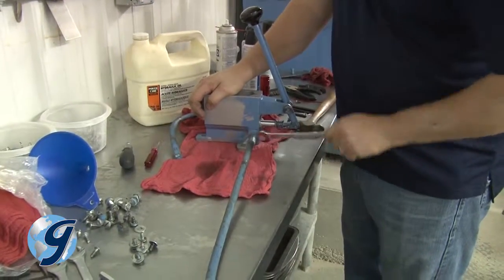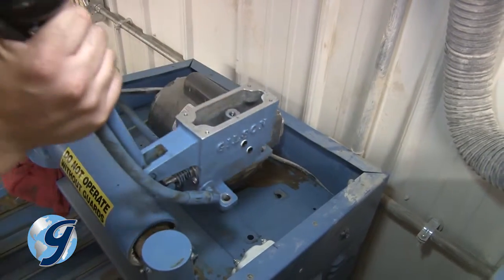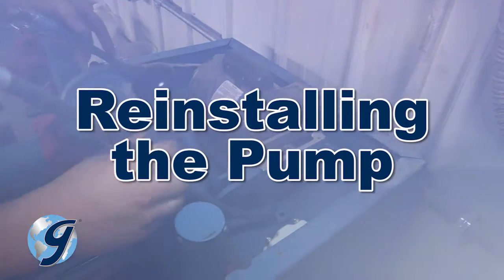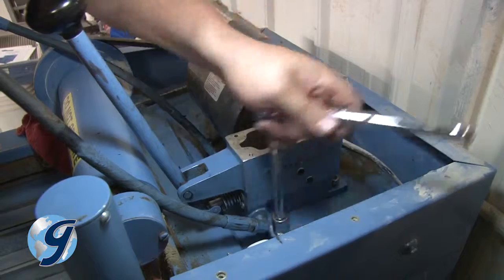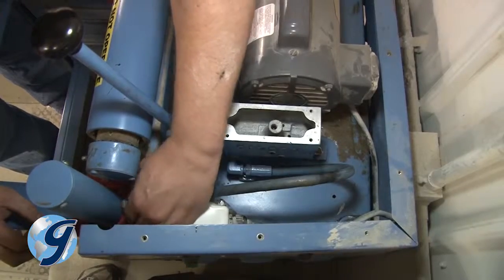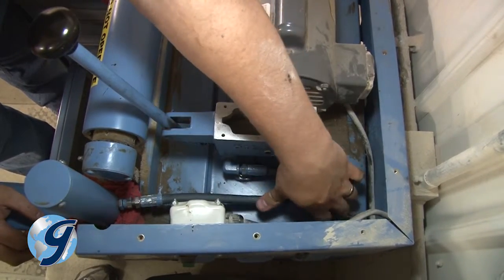Now, reinstall the hydraulic lines to the pump. And now you're ready to reattach the pump to the testing screen. Affix the pump to the testing screen using the original bolts. Now, reattach the lines at the cylinders, and make sure to leave the fittings loose so you can bleed the lines later.